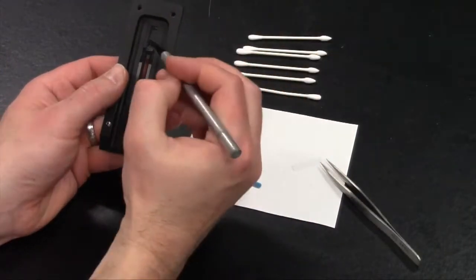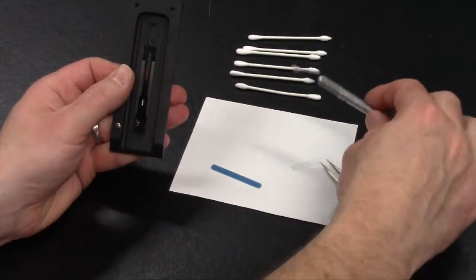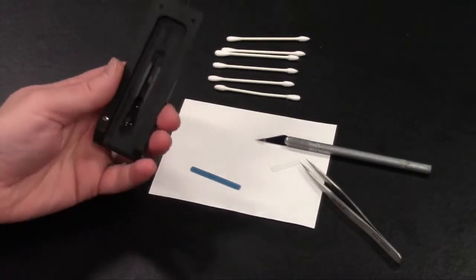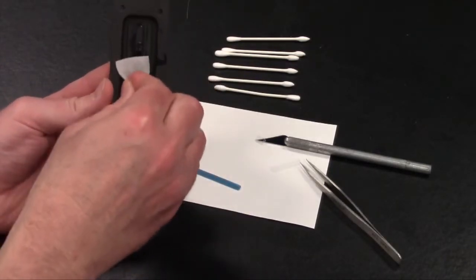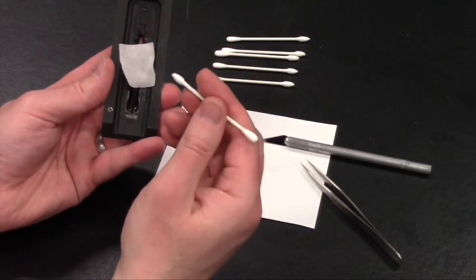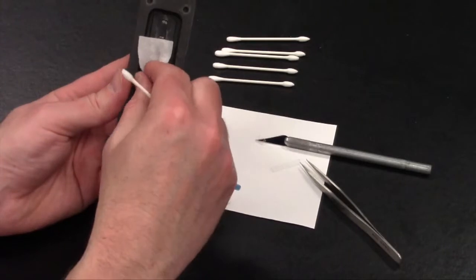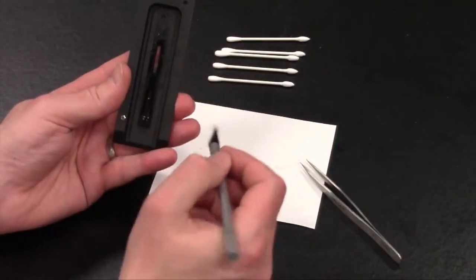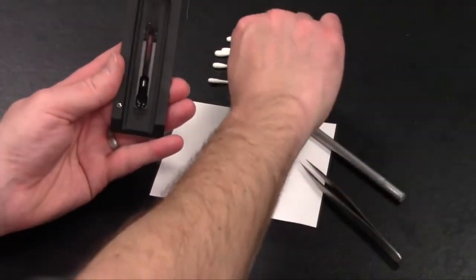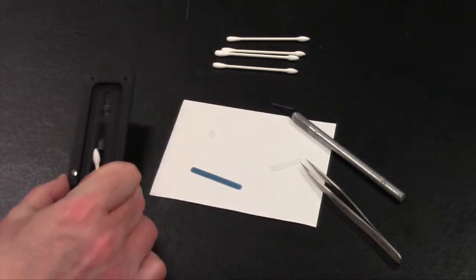Once all the last remaining pieces of the slide have been removed, again take an alcohol wipe and clean this internal area where the new window will be replaced. So take another alcohol wipe and again clean this interior area as best you can. The alcohol will help remove any of the adhesive left over from the old window. And again, remove any traces of liquid. You can use the swab now and dry this, or you can use one of the Kim wipes to remove any of the liquid that's remaining from the alcohol. Here there's a small piece of alcohol wipe left, so we will remove that. And again, dry this interior area where the new lens will be added.